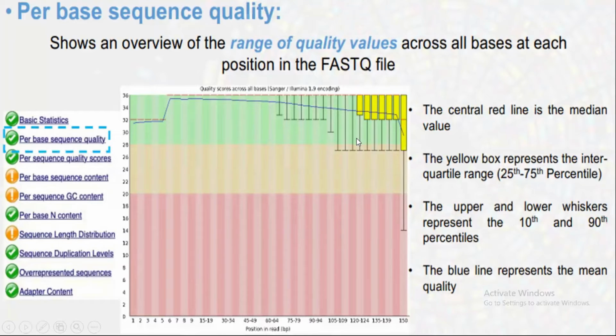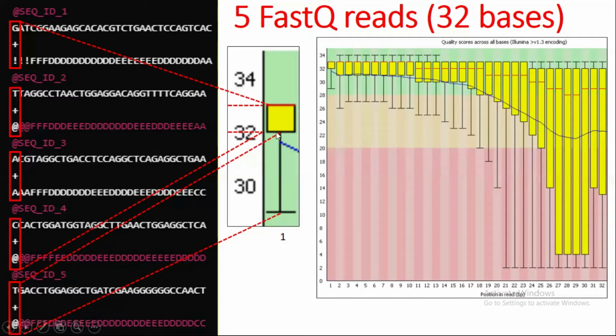The upper and the lower whisker represent the 10th and the 90th percentile. These are the whiskers. Here almost all the quality is revolving inside the box, most of the quality is on this red line, so no whisker is present. If there was a sequence read with a quality of 34, then there would be a whisker. But here almost all the quality revolves around this 33, so it does not have a whisker.